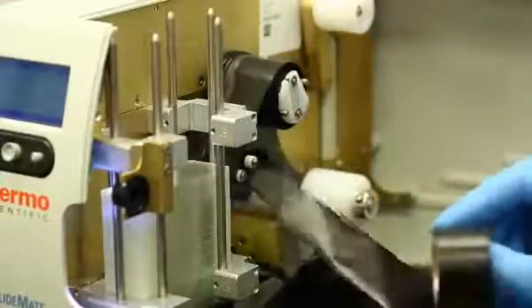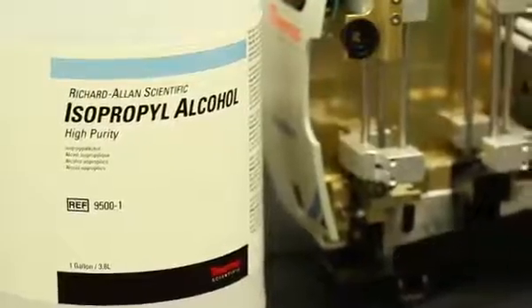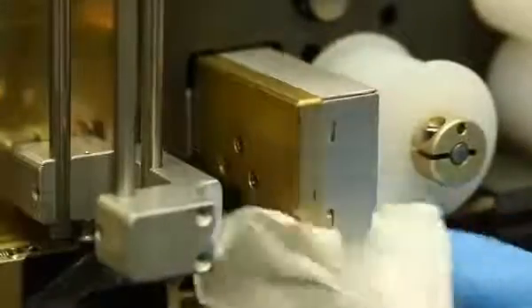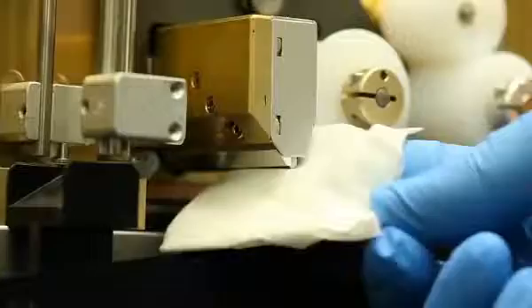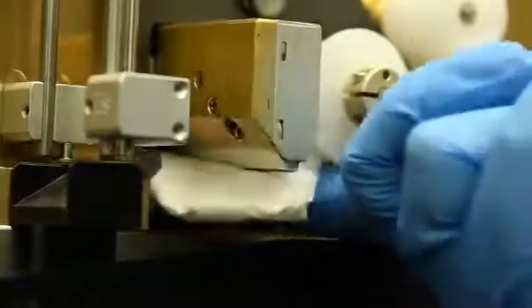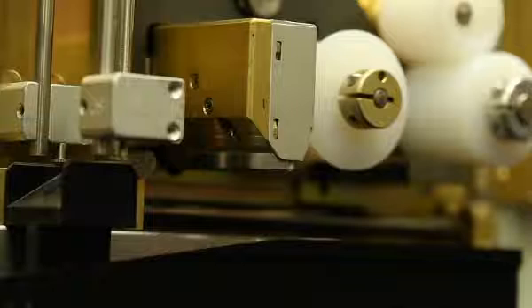To clean the printhead, Step 1. Remove the print ribbon from the unit. Step 2. Use an isopropyl alcohol wipe or lint-free cloth dampened with ethanol or isopropyl alcohol. Rub the bottom of the printhead firmly until there is no visible residue on the isopropyl alcohol wipe or lint-free cloth. Step 3. Let the printhead dry for 2 minutes before loading the ribbon.